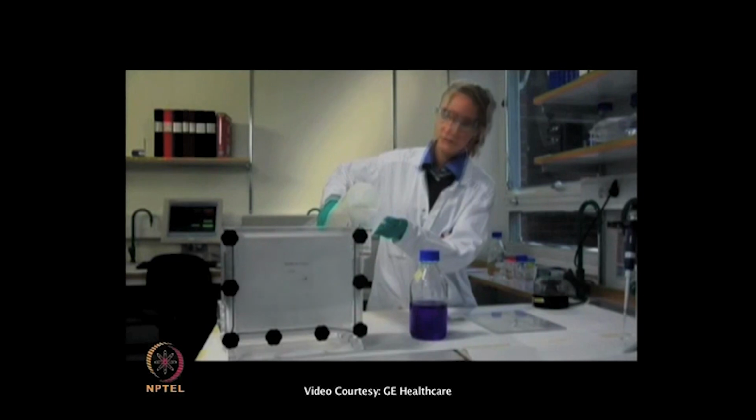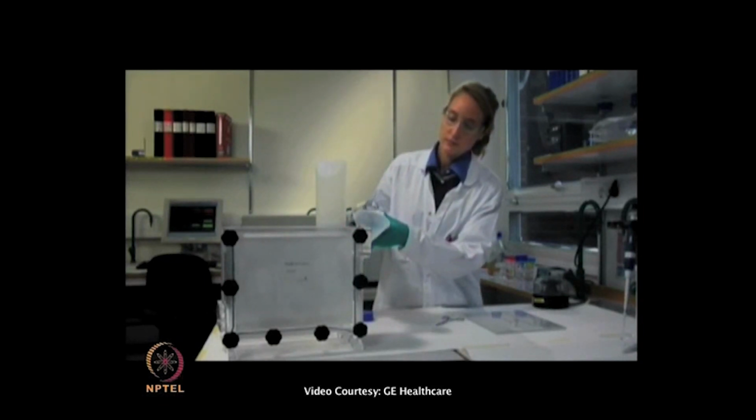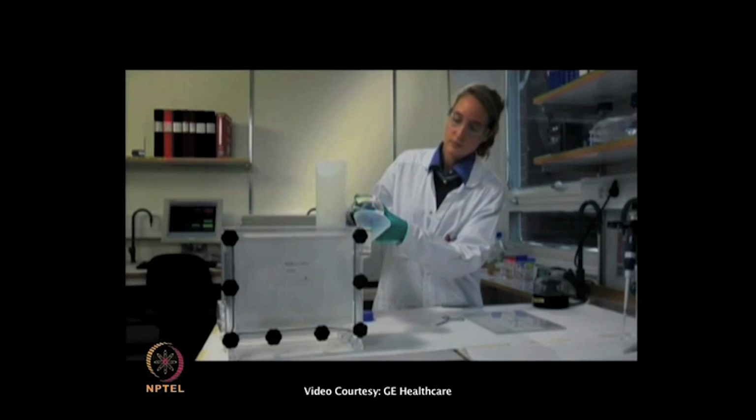Large 12% Laemmli gels were cast using a DALT 12 gel caster. Displacing solution was added to avoid polymerized acrylamide gels in the tubings. The gels were allowed to polymerize overnight at room temperature prior to use.